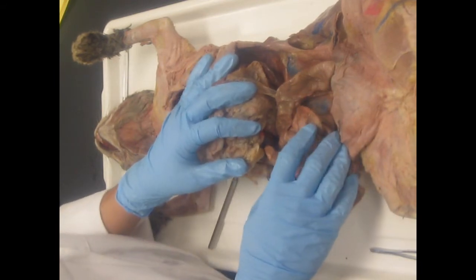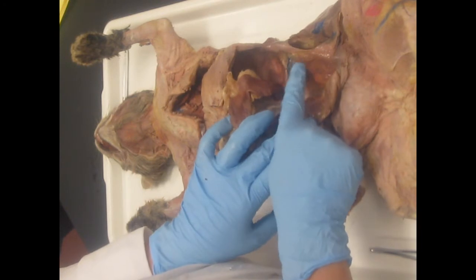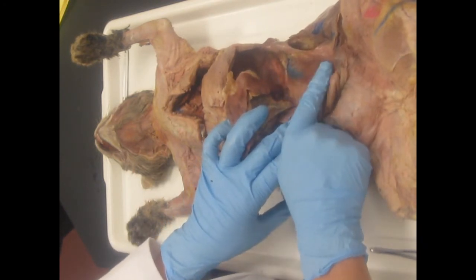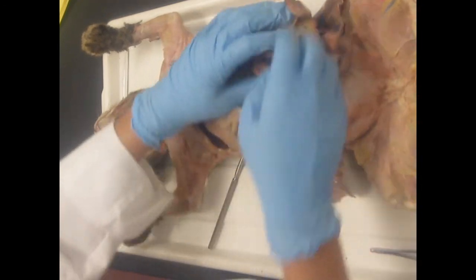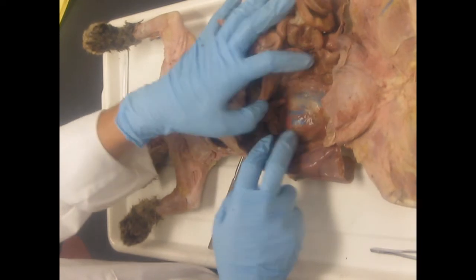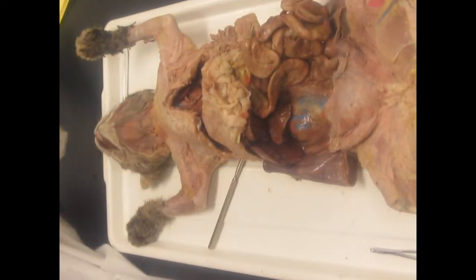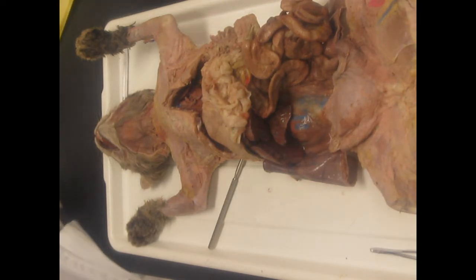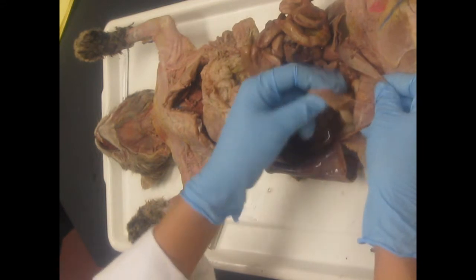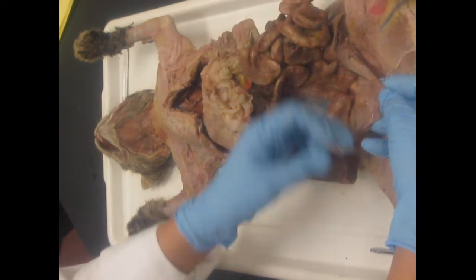Okay. And then we have some kidneys. We've got a right kidney, which is still covered by the peritoneal membrane. And we're going to open that up in the next dissection. Sorry, that was left kidney. Right kidney over here, which is a little bit hidden by the liver. Okay. Then we have urinary bladder. We showed you with cavities, and that's tethered to that muscular wall by the median umbilical ligament.